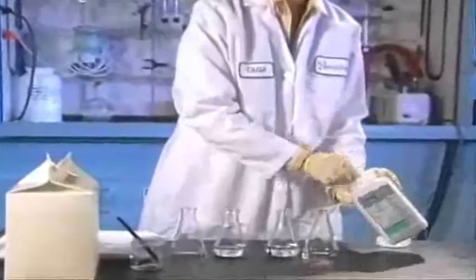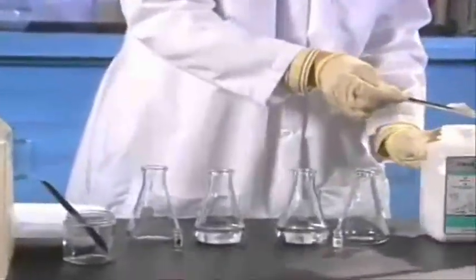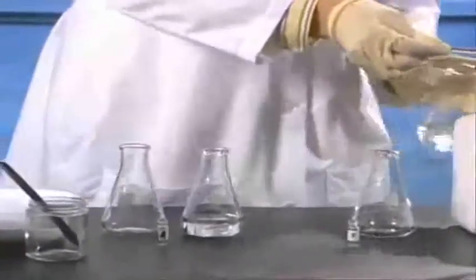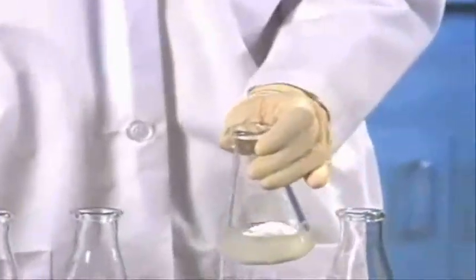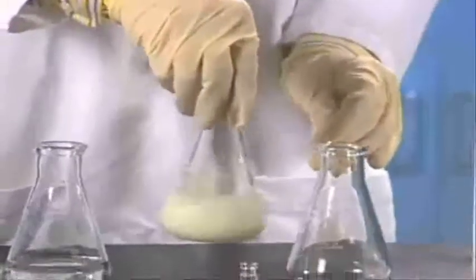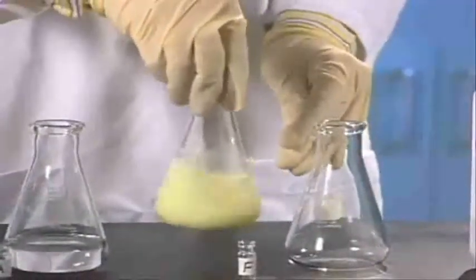Two Erlenmeyer flasks containing parathion in an organic solvent have been prepared for this demonstration. A scoop of FastAct is added to one flask. The white FastAct powder turns yellow, indicating not only absorption but also destruction of parathion.